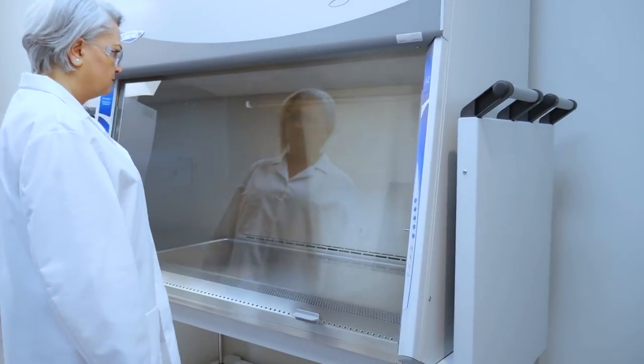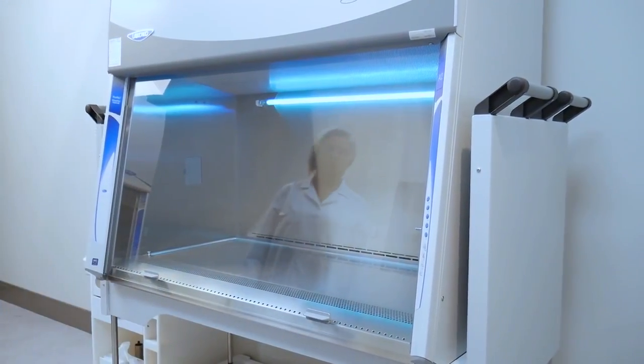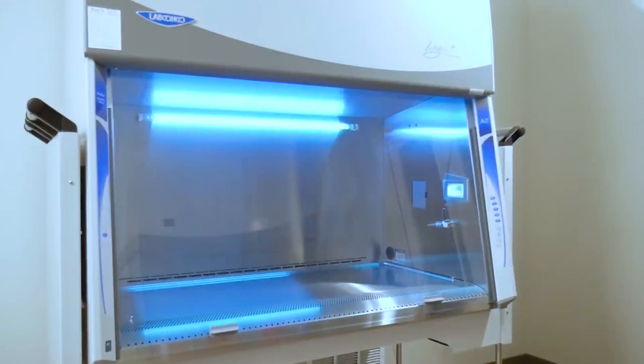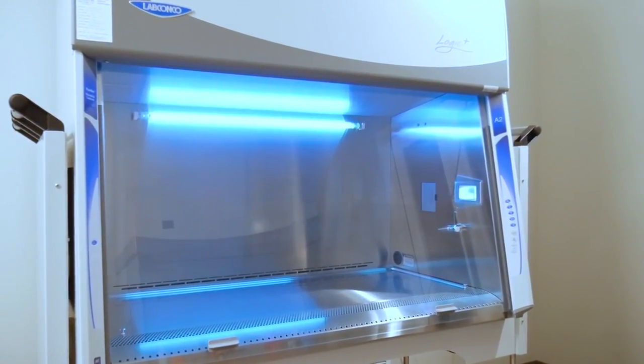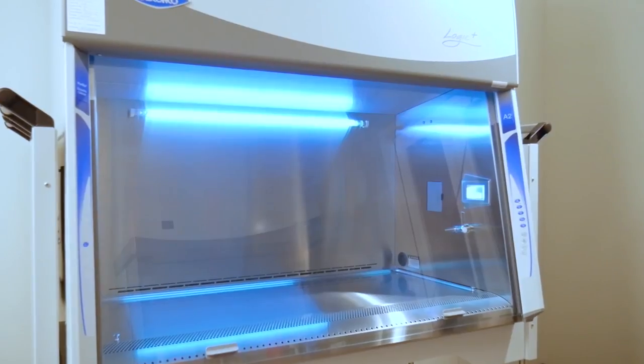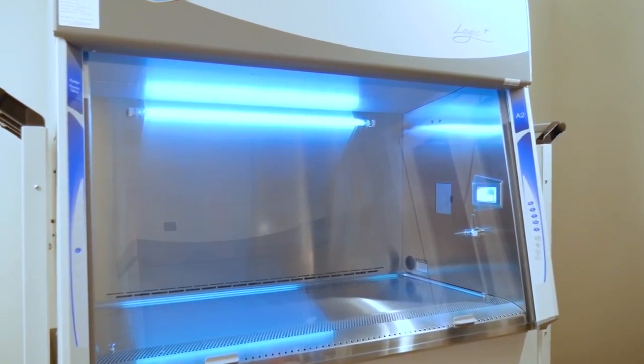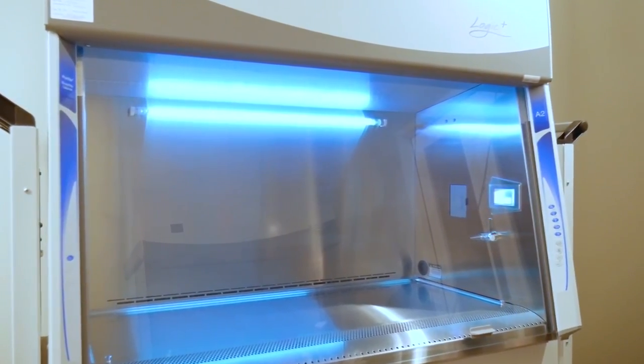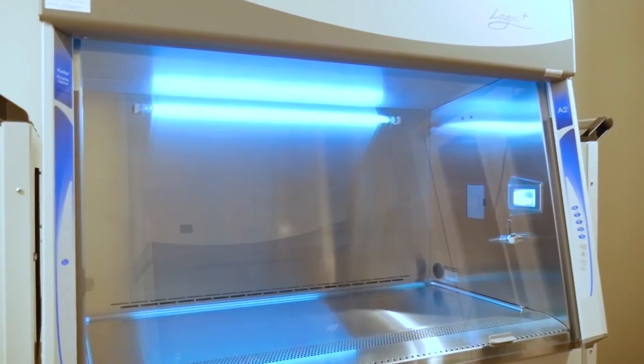LabConco BSCs can be programmed to automatically turn on NightSmart, the UV light, or both. NightSmart is an energy efficient mode that purges the work area with clean air between uses. If enabled, the UV light will turn on for a duration that you can select.